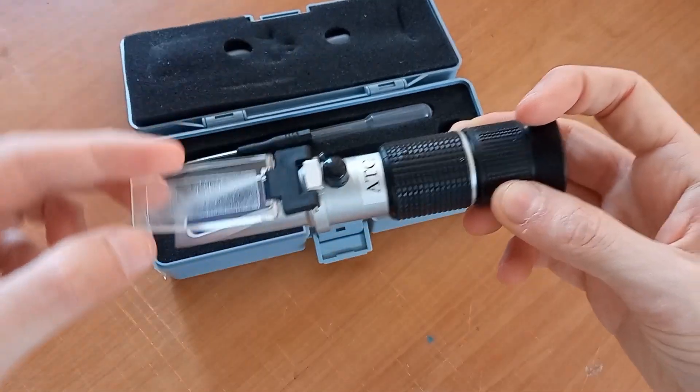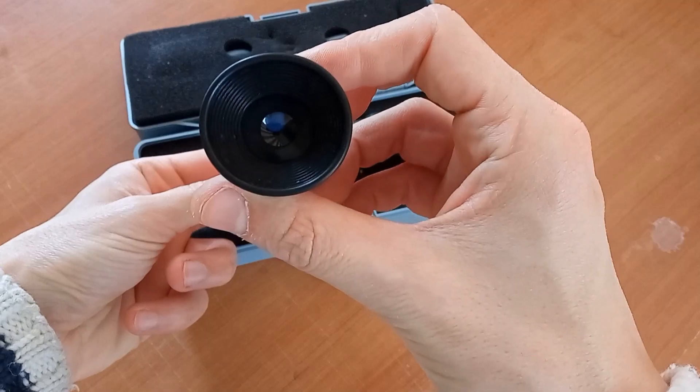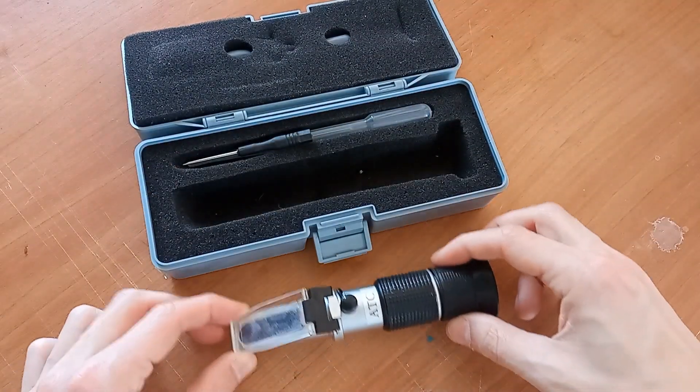Liquid sample or solution are dropped on the prism, cover applied and the instrument pointed against a strong white light or to the sky during daylight.